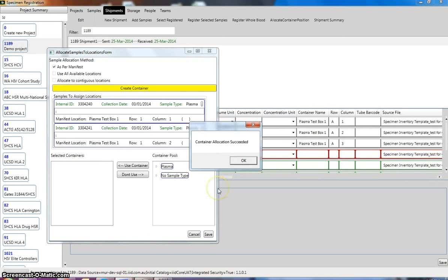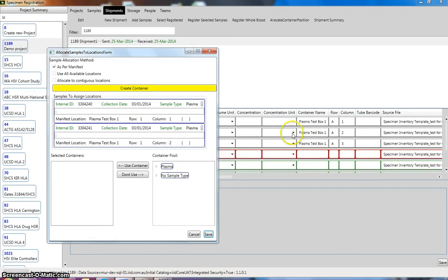That's because the system, see on this container name section here, looks into our LIMS to see if a box of the name plasma test box 1 already exists. If it doesn't exist, it will ask you to create that box in LIMS. By clicking on create container, that's basically what we've done. And now our samples have been allocated those containers as per what was given on the original manifest.